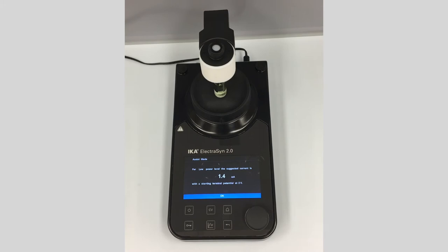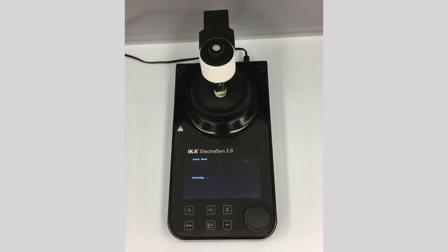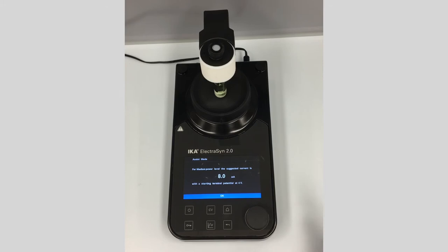For demonstration, let's click on medium — analyzing using the initial 4 volts terminal cell potential to give reaction conditions in terms of current. That's starting at about 8 milliamps, which is a little bit high, but let's run it anyway.